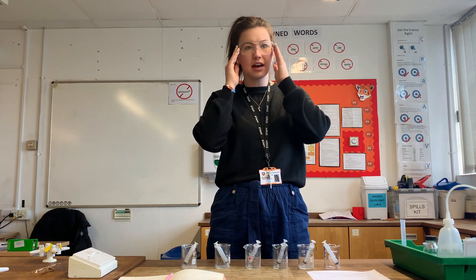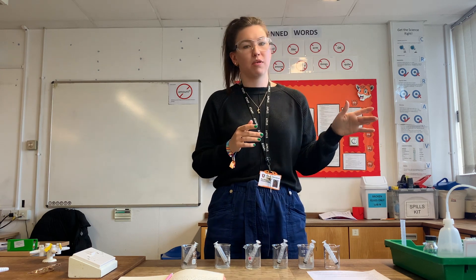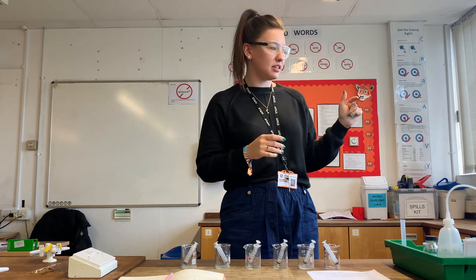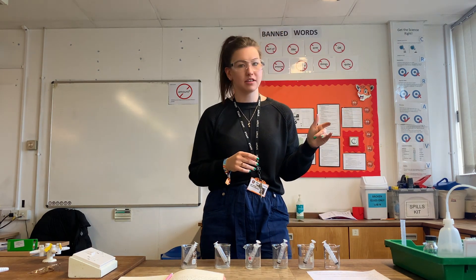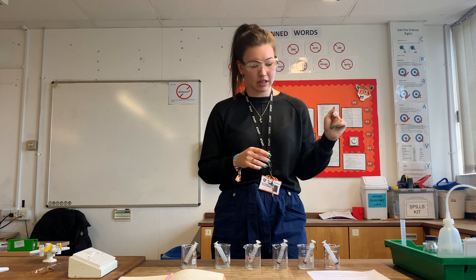Just before we start, I'm going to pop on my safety goggles - my hair's already up. We'll be using a water bath which is set to 90 to 100 degrees, so that's really hot.